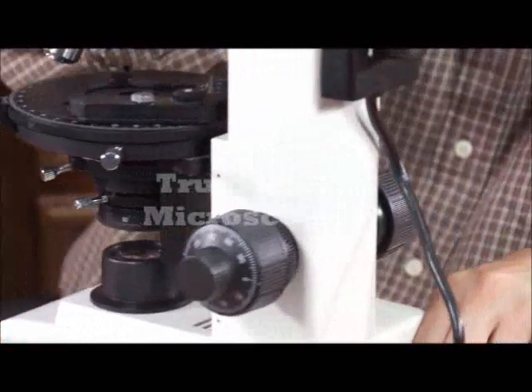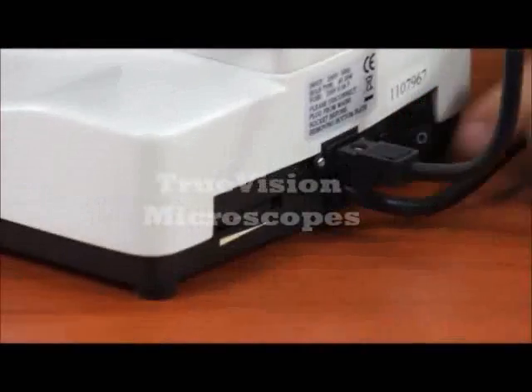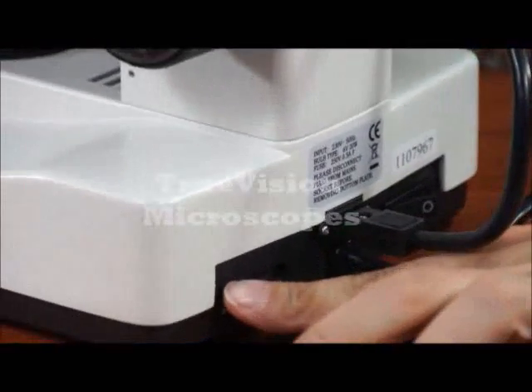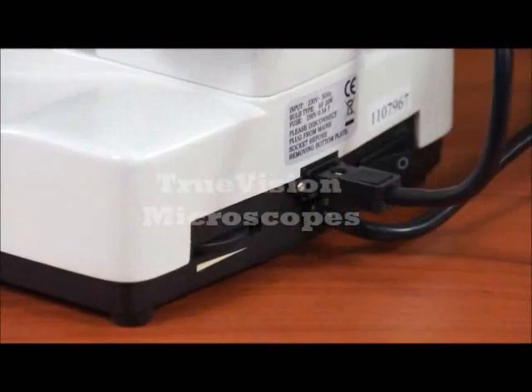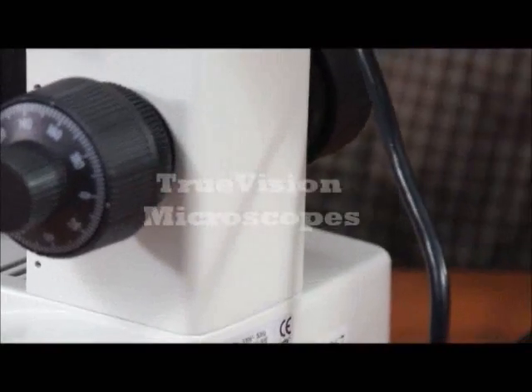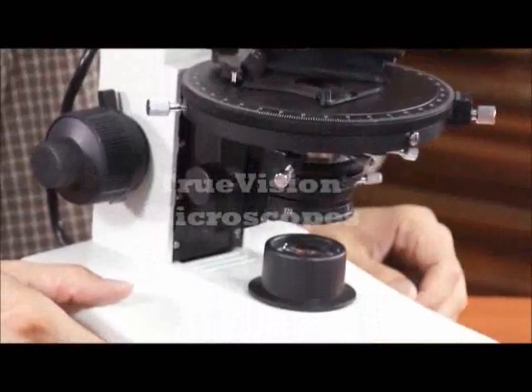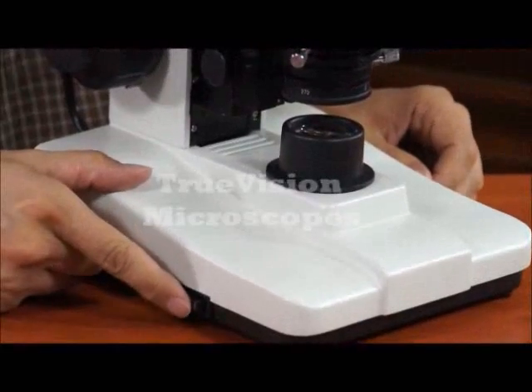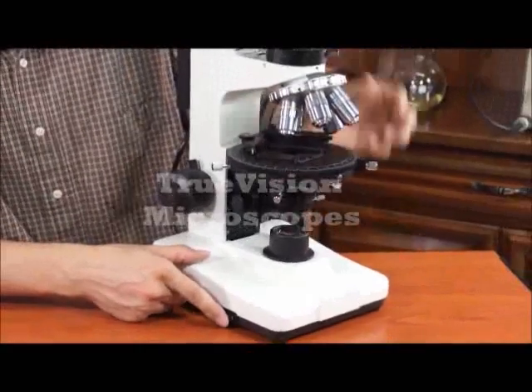There's a variable intensity knob on the back and a main on/off switch. This is the cord going to the reflected illumination bulb. This switch changes your light from the bottom transmitted to no light at all to the top reflected light.